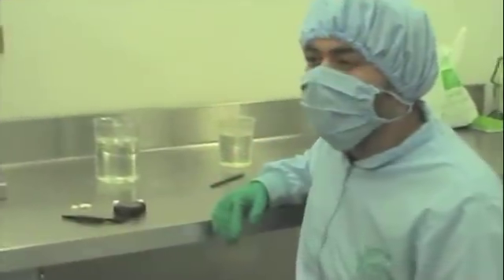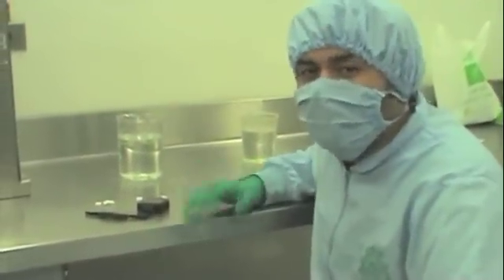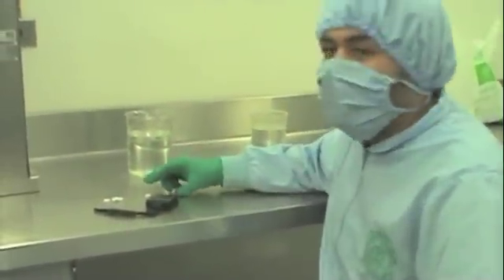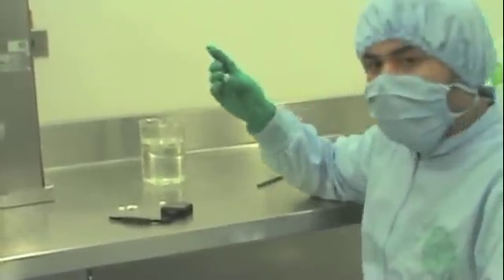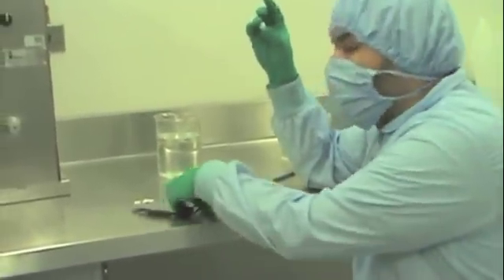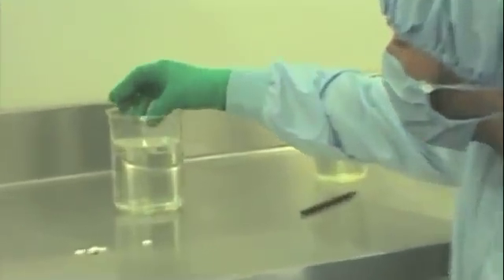The test that we are going to do here is an effervescent test. This is an aspirin final dosage form made by effervescent method. So the only thing we need to do is pour the final product here in the water and measure the time the effervescent takes place.